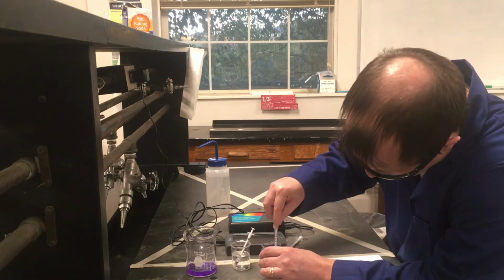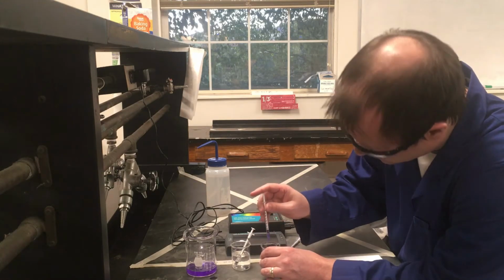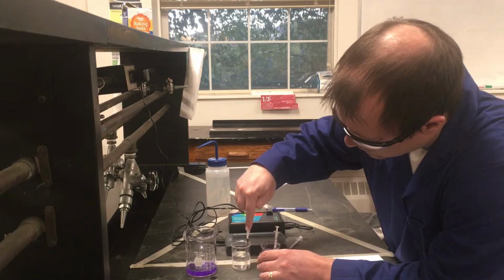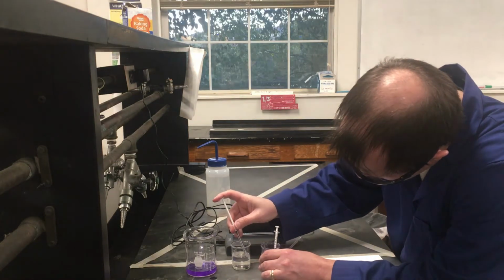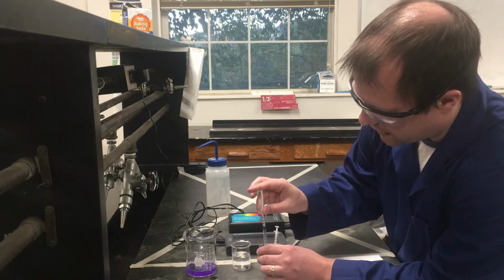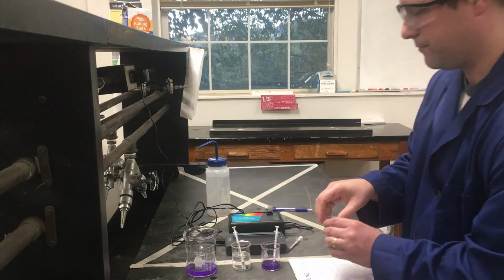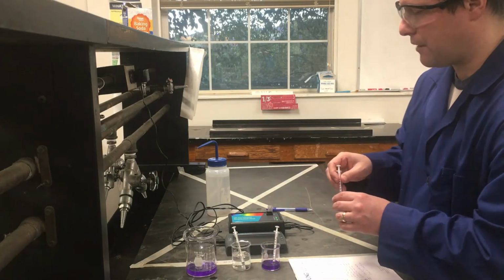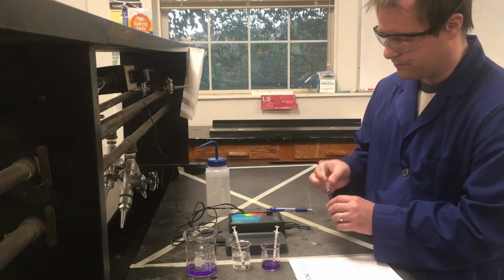And so I already got 2 milliliters, now I just need the 0.1. Just my 0.1. And then I need about 0.9 milliliters of water. So looking at this, there's about 0.9 mL of water. And once I have all of that added and I start mixing it up some, I'm just going to take some of this and add it to my cuvette that I just rinsed out, and I'm going to measure what my absorbance has now become.